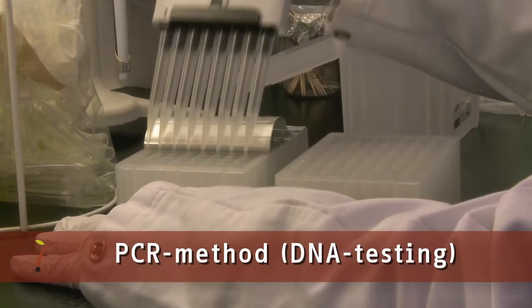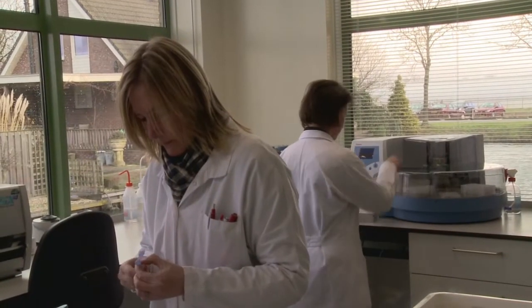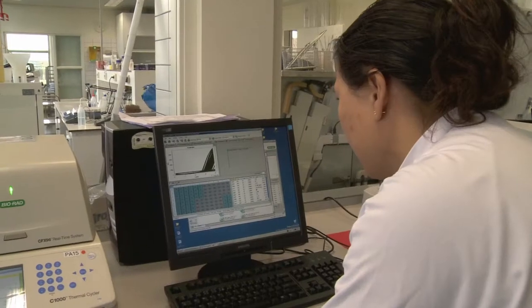The PCR method is a more sensitive and specific diagnostic tool. With this method, material is tested at the DNA level. Pathogens can be detected in seeds, plant material, soil and water.